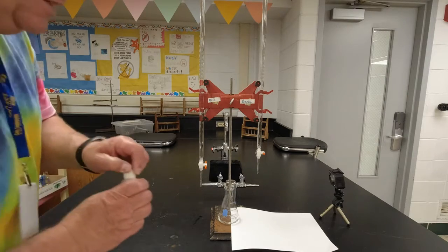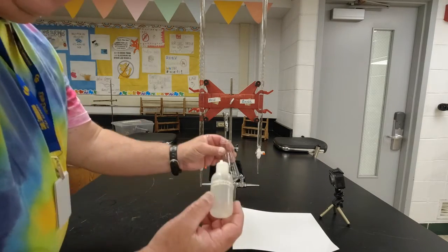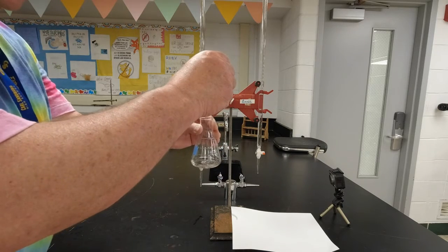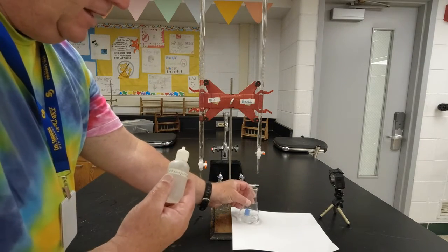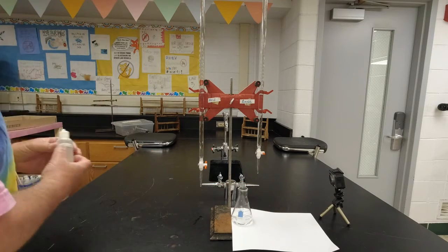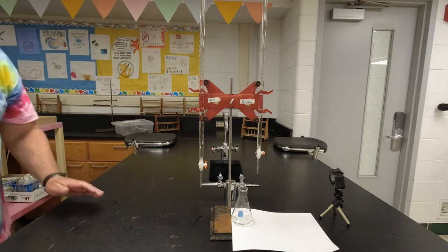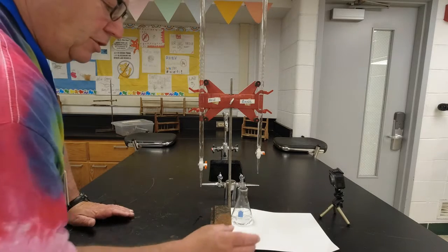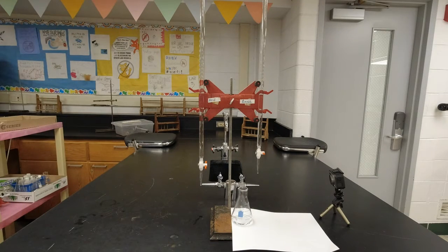All right, now that I've got the acid in there, I also need to add 1 or 2 drops, 3 drops of phenolphthalein. So I put 3 drops in there, and it shouldn't be surprising that it didn't change colors because phenolphthalein, in an acid, stays clear, and when it hits neutral and goes to a base, it's going to be just slightly pink. Okay, so that's what we're trying to do, is get to just slightly pink.